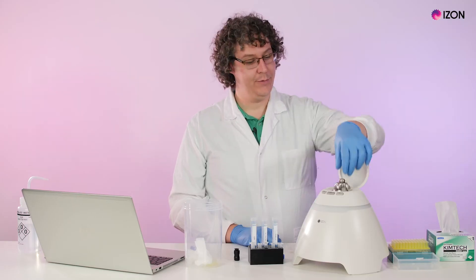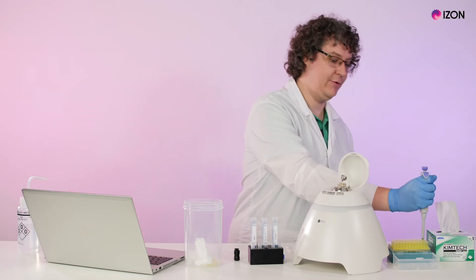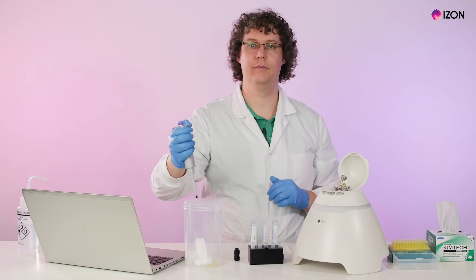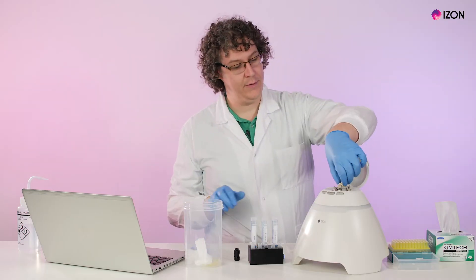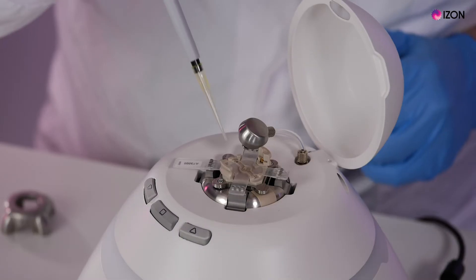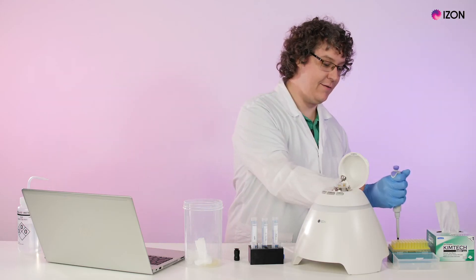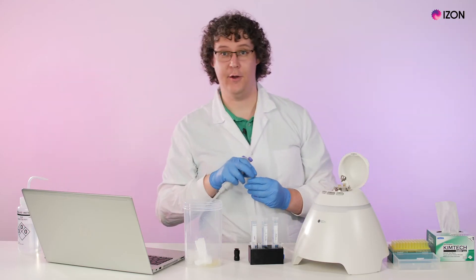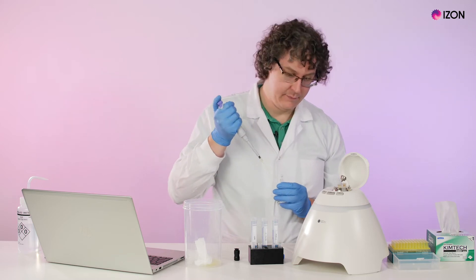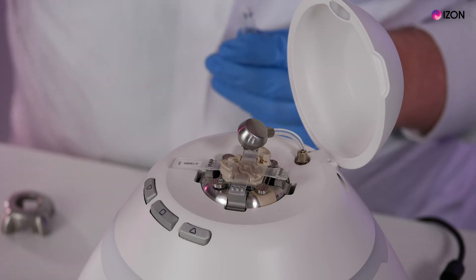Otherwise, remove the pressure nozzle and the shielding cap, remove the electrolyte from the upper fluid cell, remove the upper fluid cell, then remove the electrolyte from the lower fluid cell. Load 75 microliters of izon coating solution into the lower fluid cell, checking that there are no bubbles.